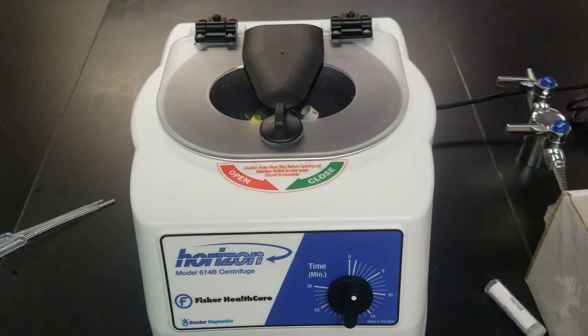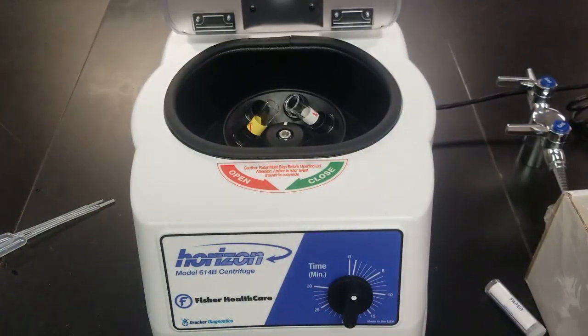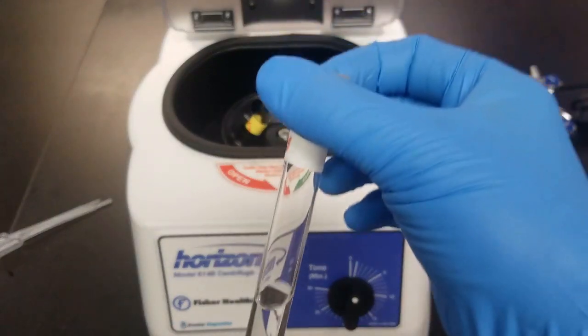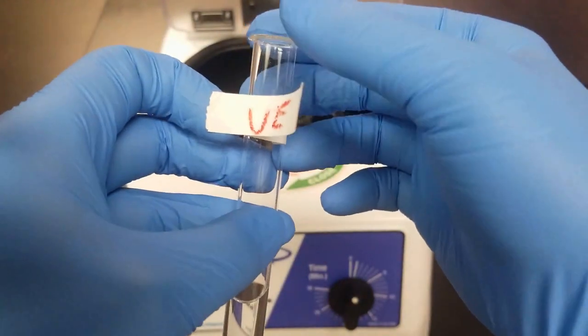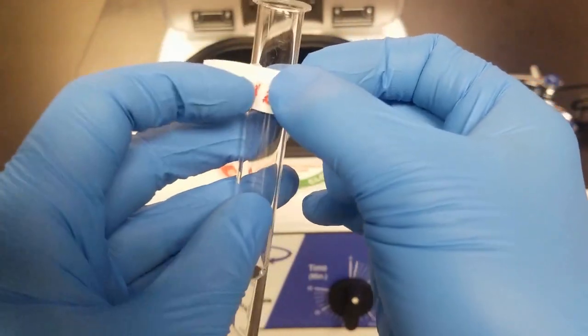All right, so as you can see, the centrifugation is done. I've gone ahead and let the centrifuge stop. I'll open it up. And then the next thing I'm supposed to do is decant to separate the precipitate and the supernatant. So decanting just means pouring to separate the solid and the liquid. So for my unknown, as we saw before, we had no solid, so you can't really decant if you don't have a solid. So we're going to save this part for part E. So I'm just going to put a new label on it and save it for part E.